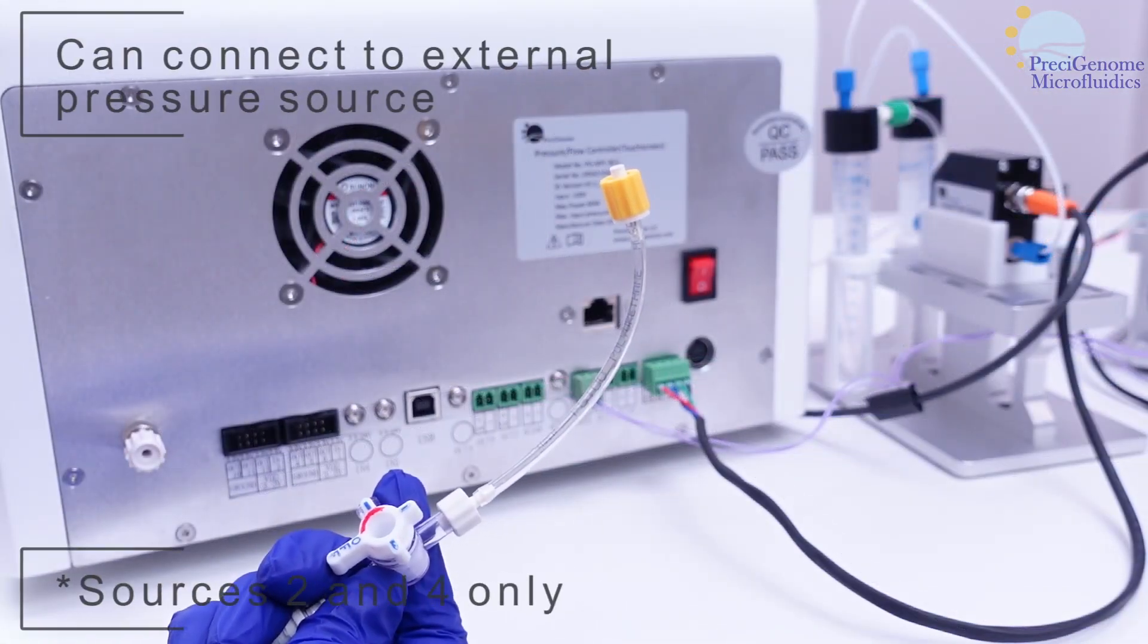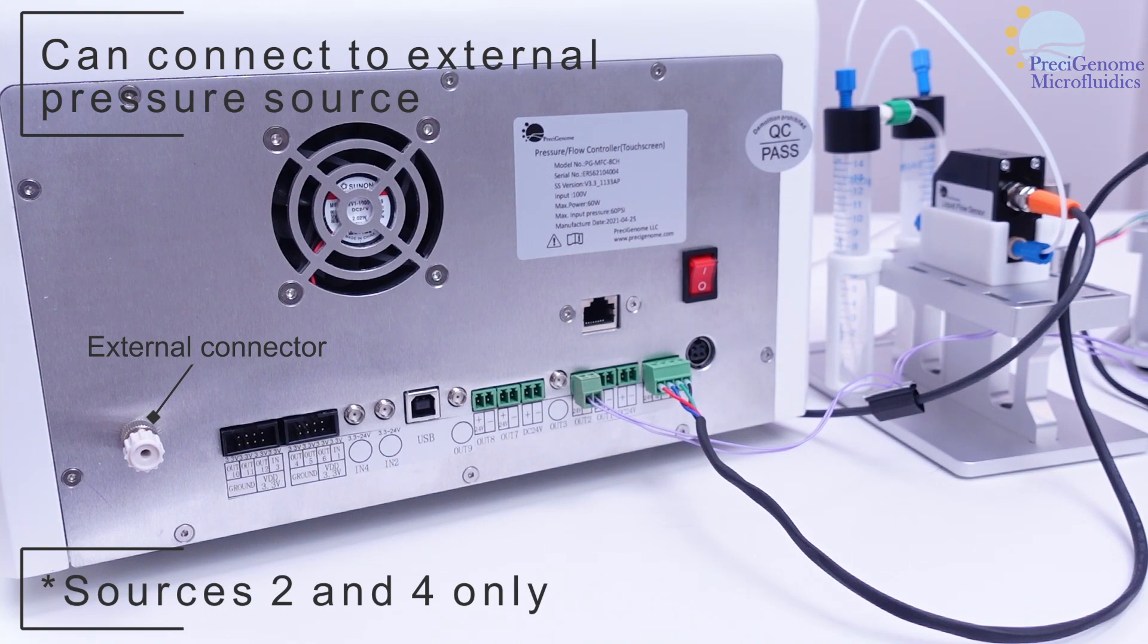The iFlowTouch is also compatible with external pressure sources, which connect to it here.